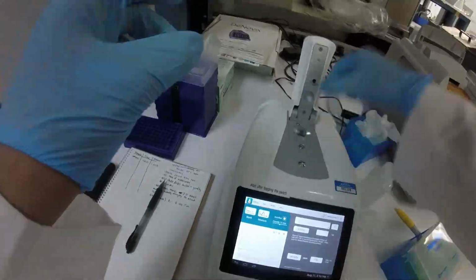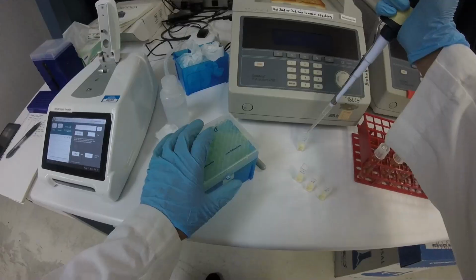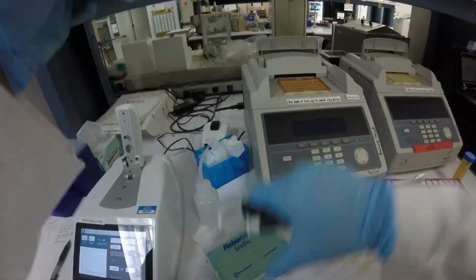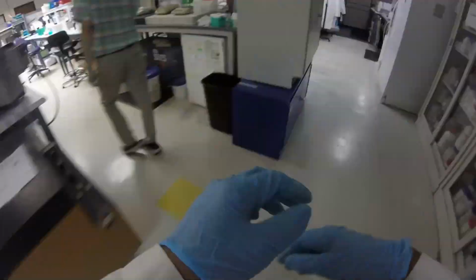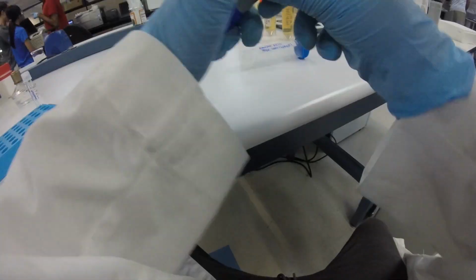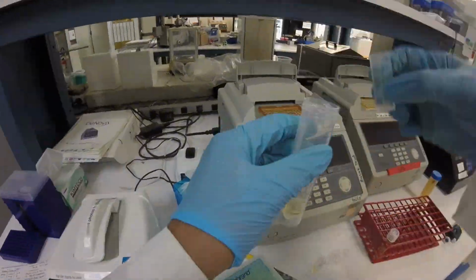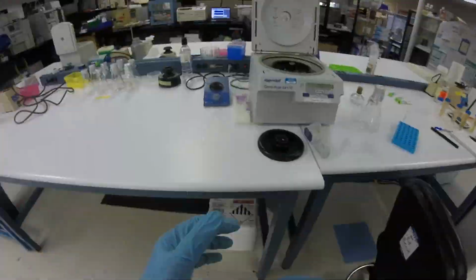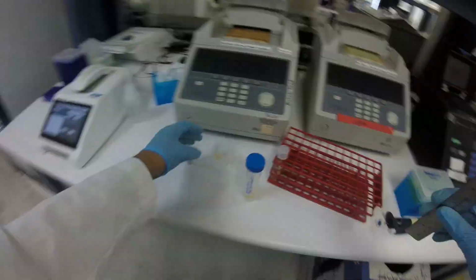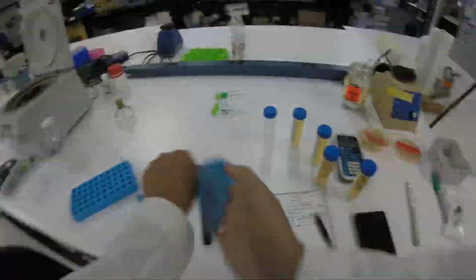I would take the cuvettes manually over to the spectrophotometer, record my data, write it down, and then return the cuvettes to where they need to go. Then the machine would remove the media into a waste container and refill it 30 minutes later, so that I don't have to babysit as much. I spent 6 hours on this, and it doesn't feel like a waste, but I couldn't do anything in the interim.